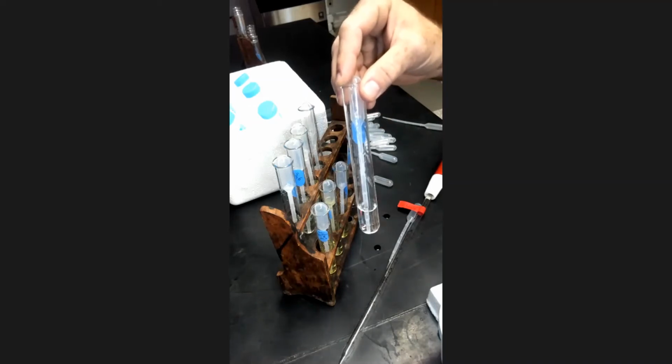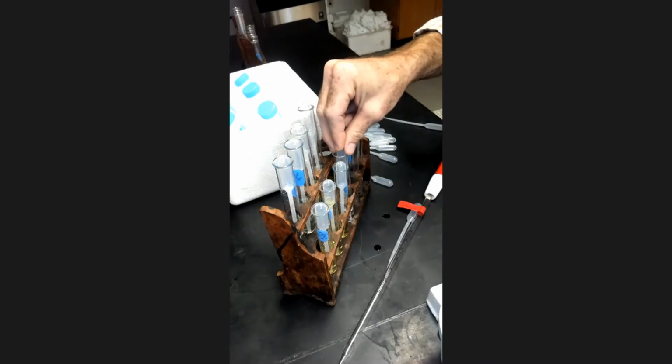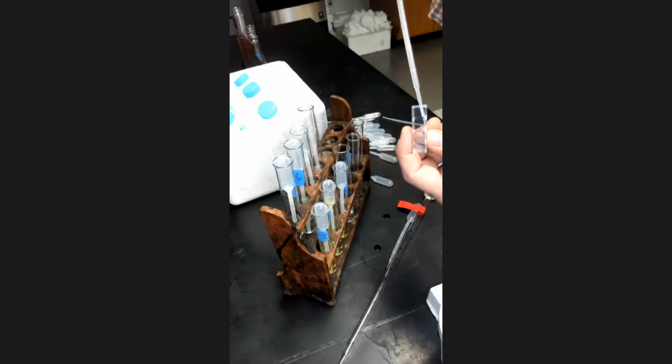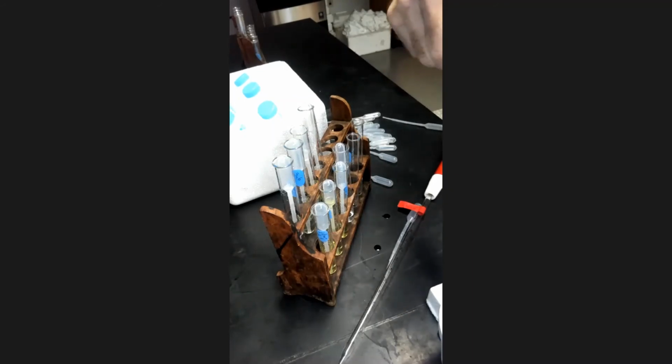Now I'm going to start with this tube over here, which is actually a tube to which I added no enzyme. It's my blank. This will serve as my control because it will tell me exactly how much absorbance I expect when I know that no reaction has taken place. So I will use my pipette in that tube to fill up my cuvette here. Specific volume, not super important, just needs to be probably about 3/4 of the way filled up. Then I can put my cap onto it and I can head over to the spectrophotometer.